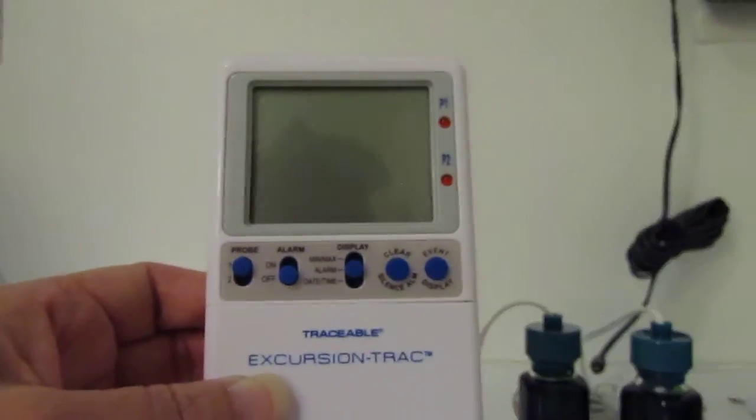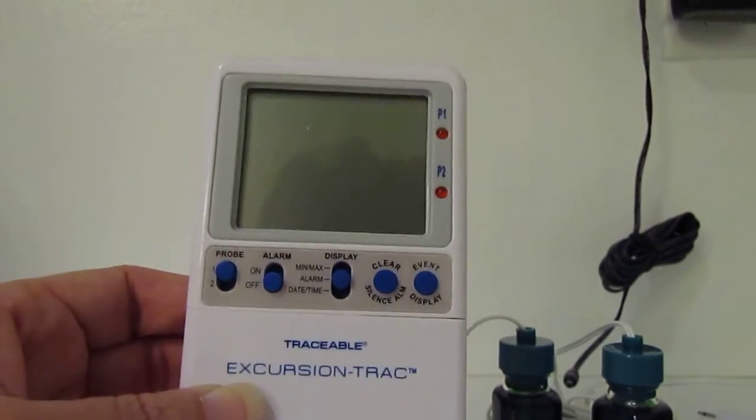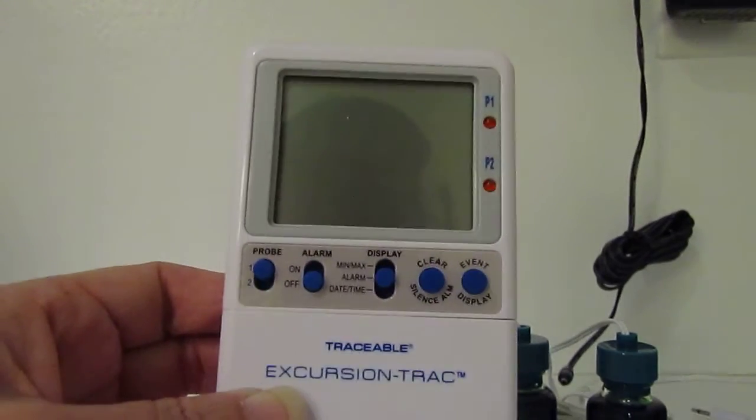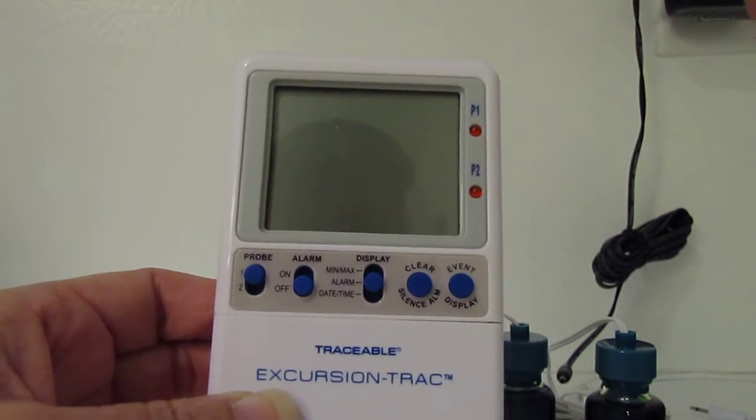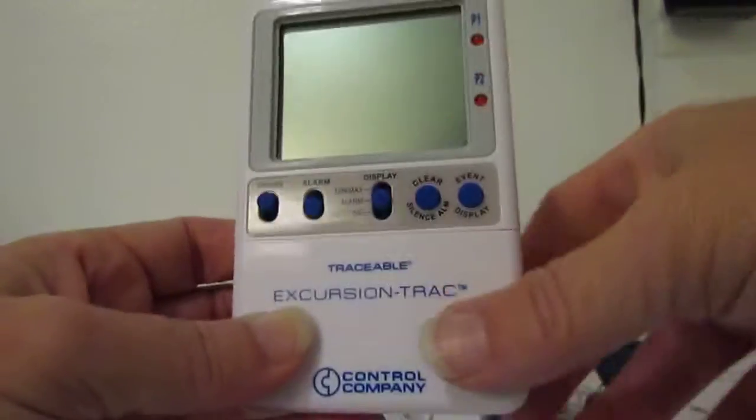The first thing I noticed is the instructions for this thing are horrible. When you first get the unit and you're trying to figure out how to turn it on, the first thing you need to do is remove the back.